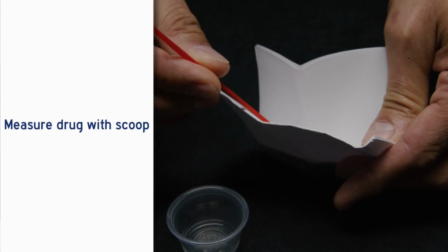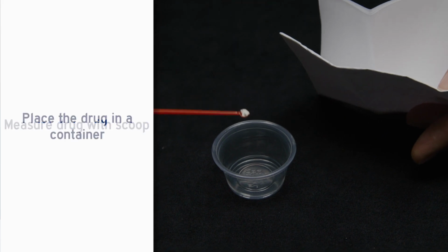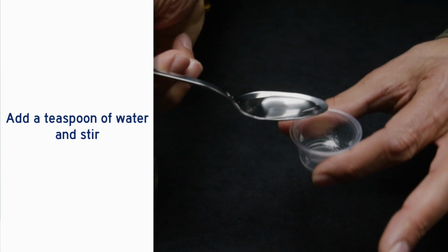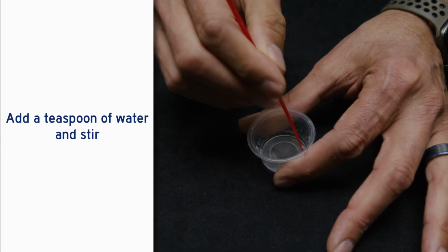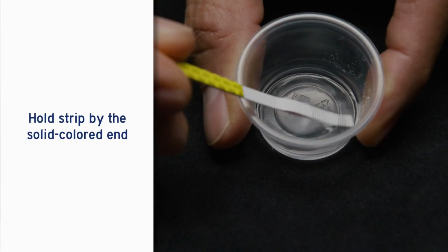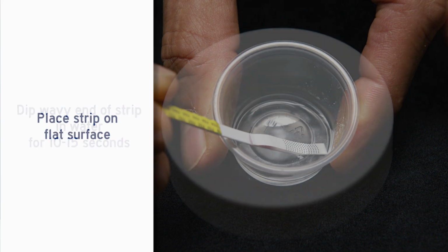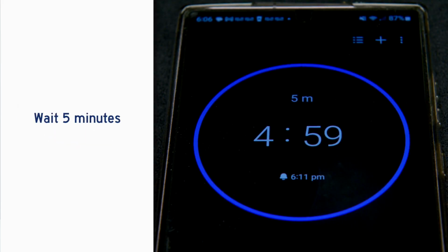Take a small amount of the substance, just a few grains, and add it to the testing container. Add a teaspoon of water and stir until it is completely dissolved. Hold the strip by the solid colored end. Dip the wavy end of the strip in the water for 10 to 15 seconds. Place the strip on a flat, hard surface and wait for 5 minutes before reading the results.